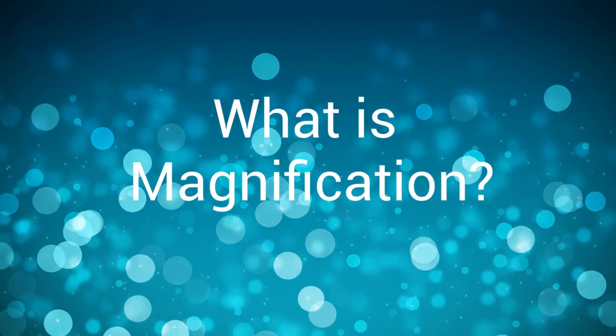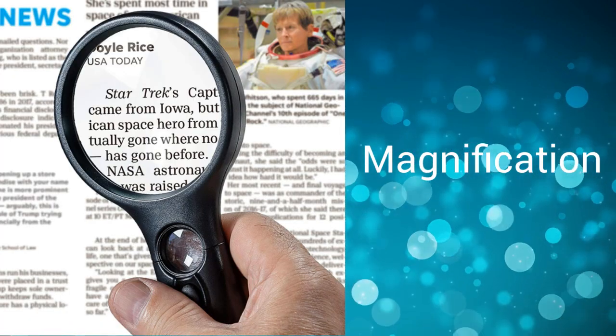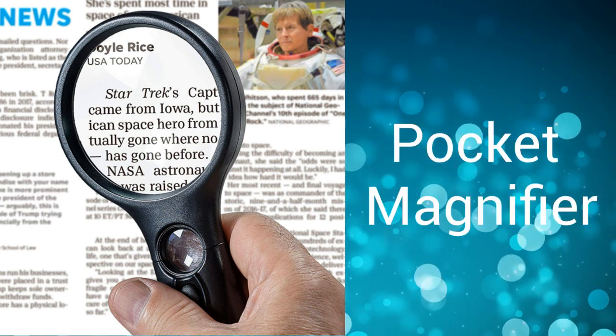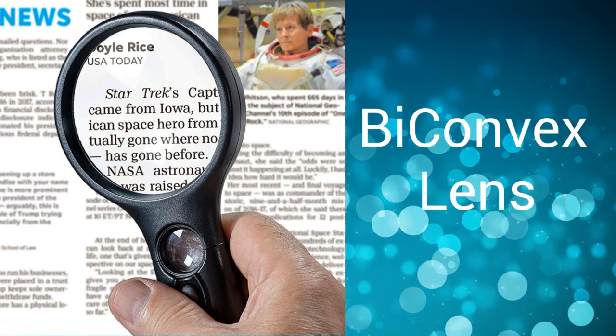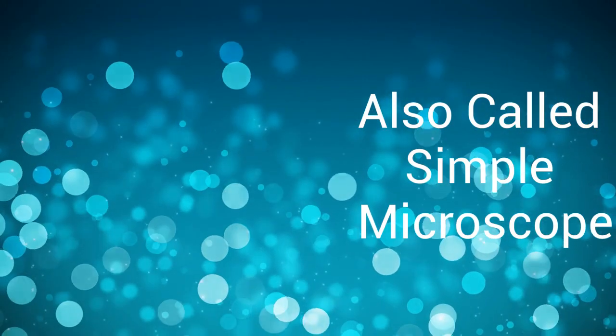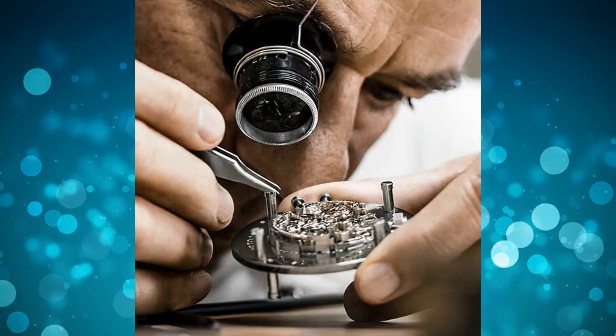What is magnification? Magnification is the process of enlarging the apparent size of an object. Its simplest example is a pocket magnifier. It is a convex lens that makes things look bigger. This is also called a simple microscope. Simple microscopes are commonly used by jewelers and watch mechanics.